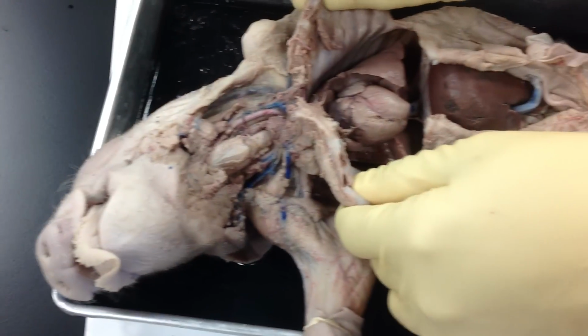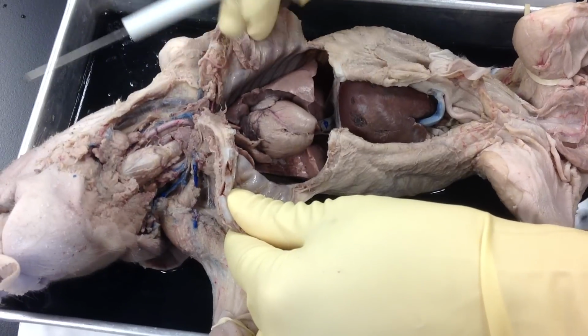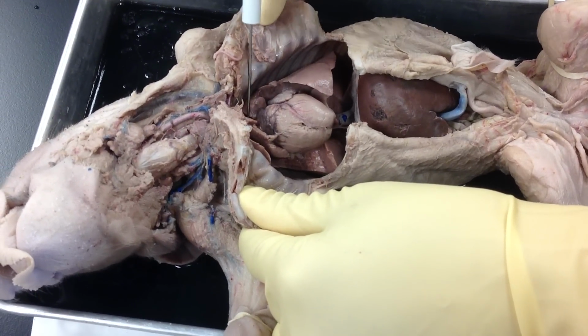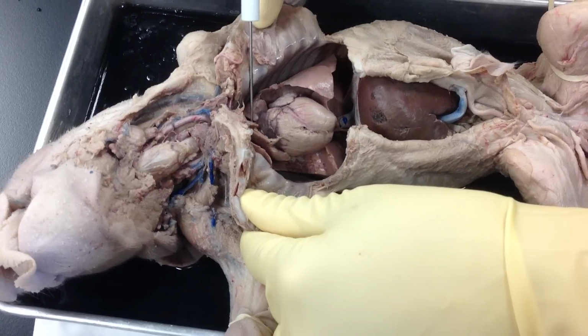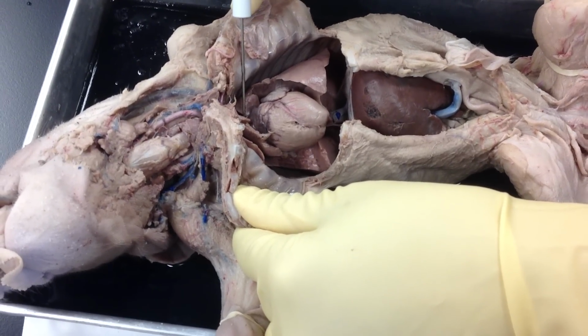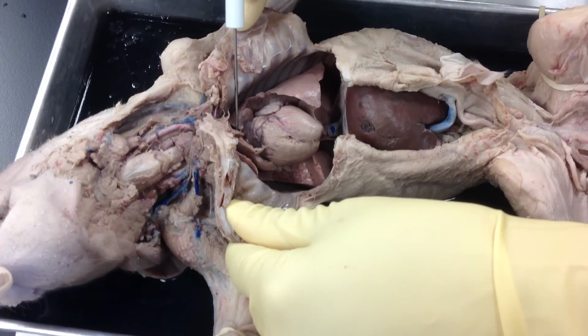Let's move down into the thoracic section of the pig. Of course, if I open it up, I've got the ribs on the outside, and then I've got the heart on the inside, and we're going to talk about the chambers of the heart. But at the very top of the heart, where the blood supply is, I've got my aorta, or my aortic branch, okay? The very top of the heart. And it's an artery, so it'll be colored red, all right?